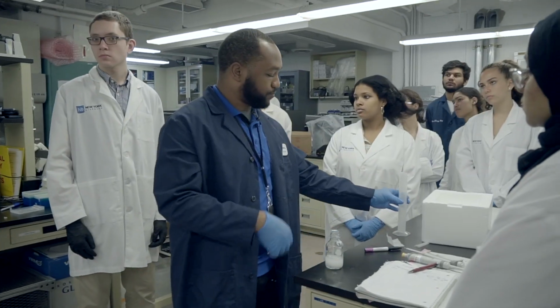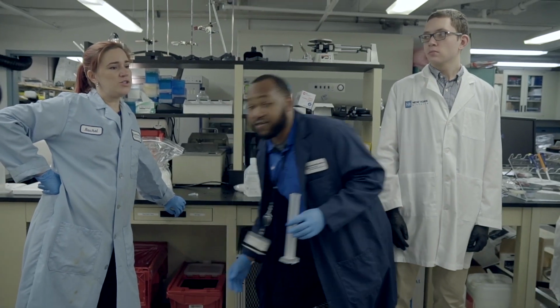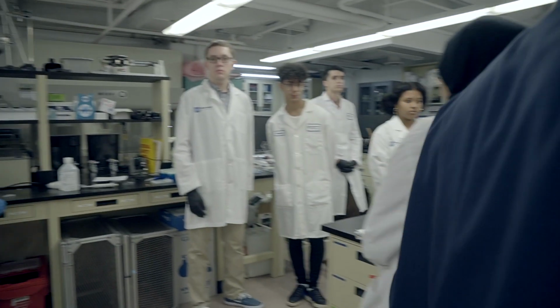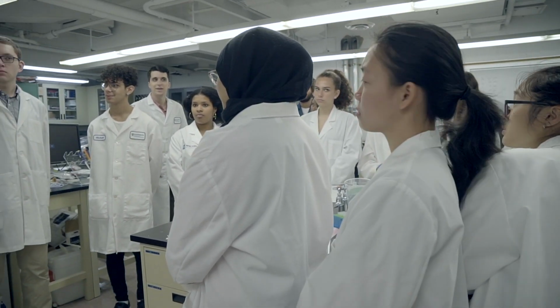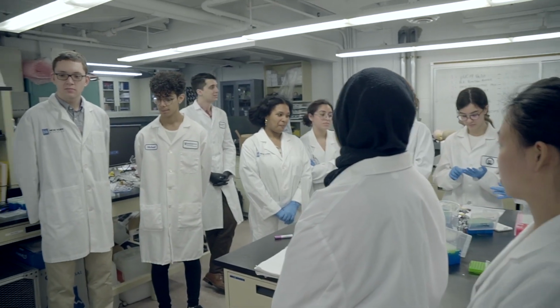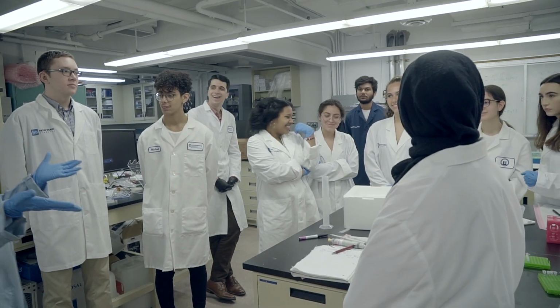So, for all of you, if we had a higher percentage of agarose in there, for example a 4% gel, do you think the pores are going to be bigger or smaller? What do you got? I'm hearing it, but you guys are too quiet. Be confident. I just heard a bunch of people say it. You're saying it in a very small voice, but you're right, smaller, yes.